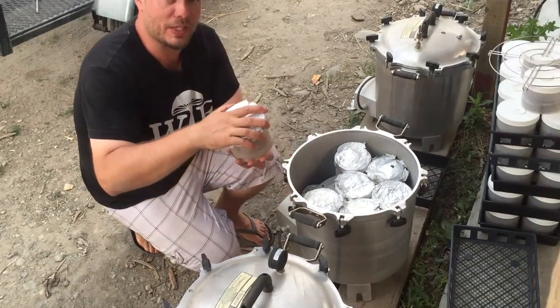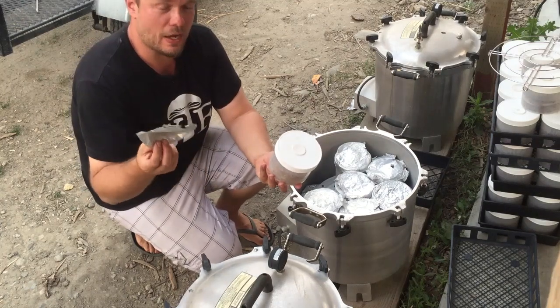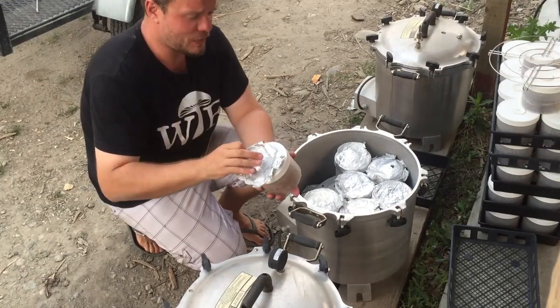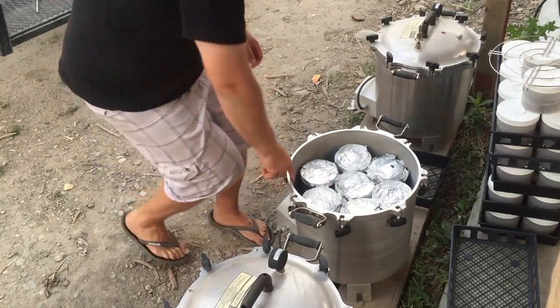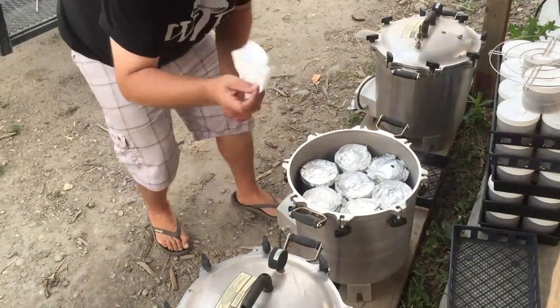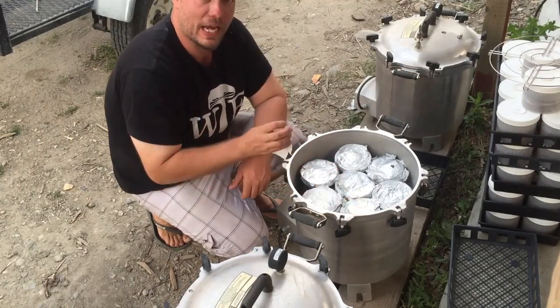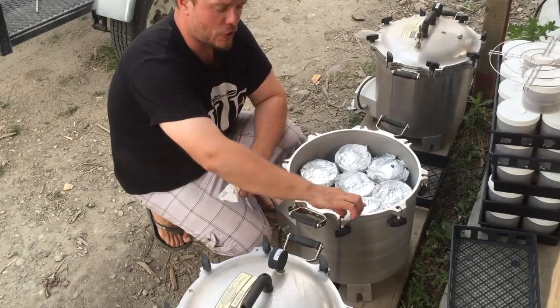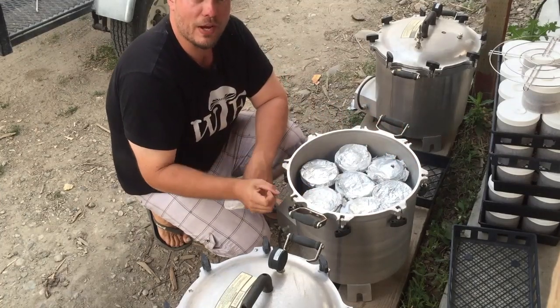We put a little bit of tin foil just over top of these jars so water doesn't get absorbed through the filter patch. Everything gets wrapped in tin foil and we reuse these a lot. We wipe the seal with a paper towel — you can see all this grit coming off. All of this grit will allow air to escape, and if you don't clean it off, you'll get little air pockets and the unit won't pressurize. Every four weeks or so, put a little bit of Vaseline on the edge to keep the metal-to-metal seal clean and prevent it from drying out.